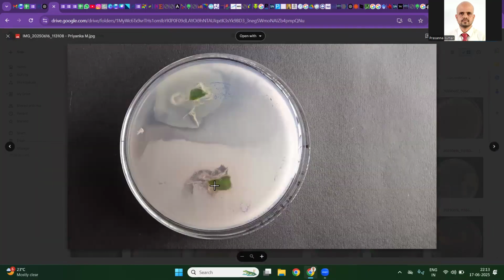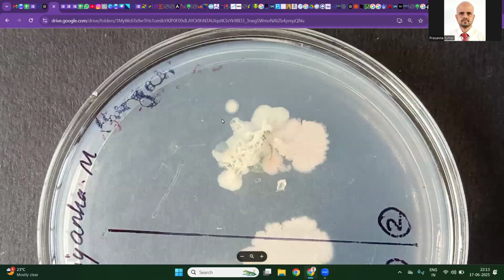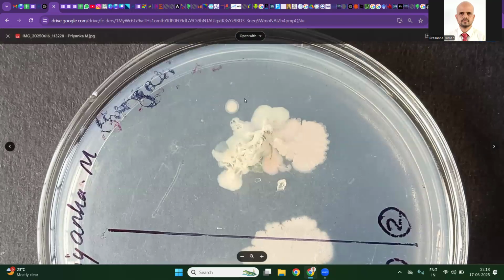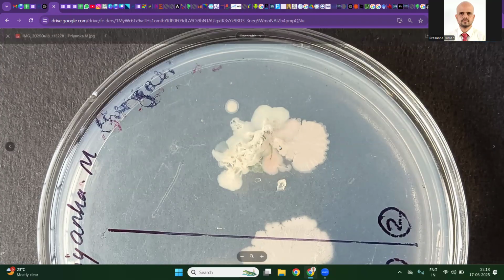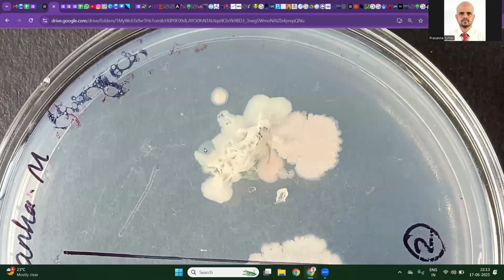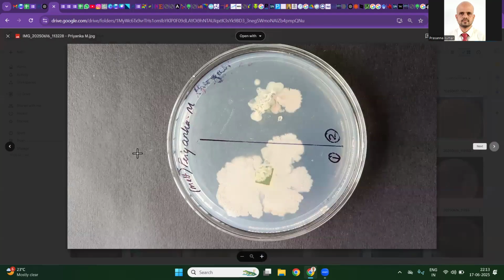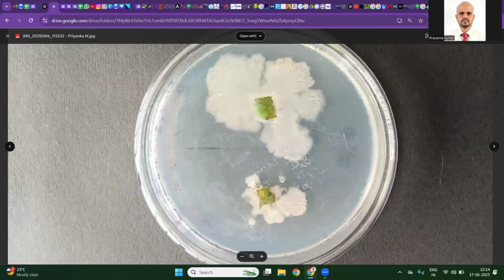I think fungus-like growth is happening. Here also we have two kinds of endophyte, but swarmers are also there. We have to question our observation. If the imprint is clean, this is what I meant. This colony is definitely not an endophyte. An endophyte cannot jump from here to there and form a colony. I can see two types of pigmentation here, and maybe one translucent colony also. So one, two, three, we may have three different morphotypes. We need to go for pure culturing and characterization to confirm whether they're actually three different species.